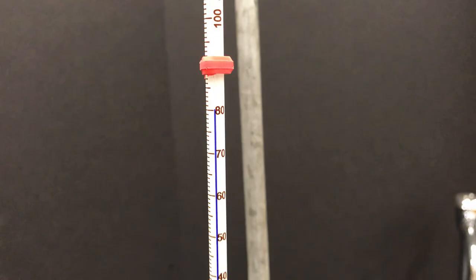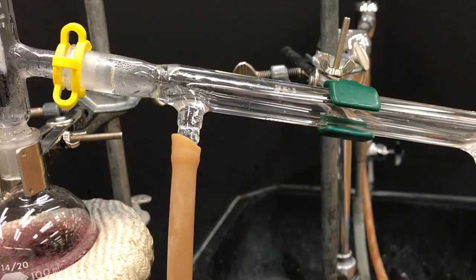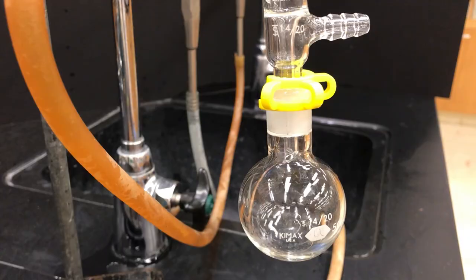The temperature right now is a little over 80 degrees. The boiling point of ethanol or alcohol is 78, and so the distillate that you're collecting probably has water and alcohol in it. You normally distill at a temperature between the two boiling points of the material you're collecting, but our distillate has a lot of alcohol in it, and the red wine has been purified through distillation.